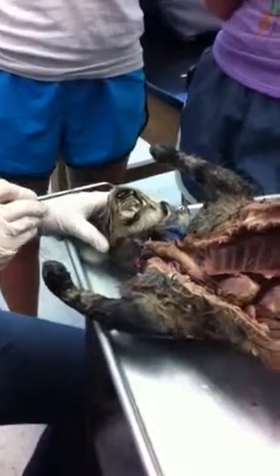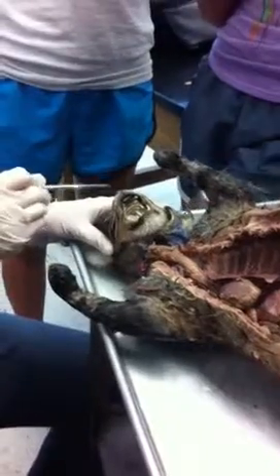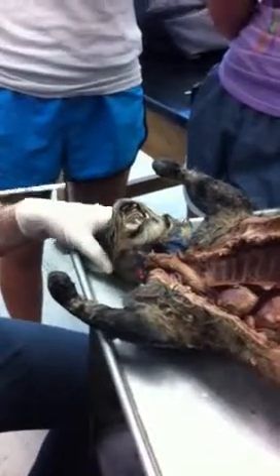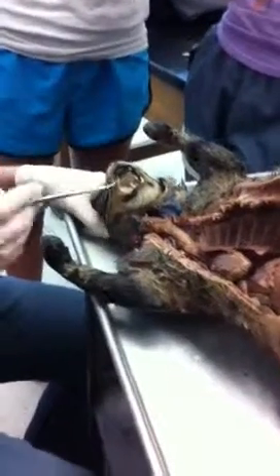Oral cavity, and here is what cavity? Nasal cavity. What are these called here? Nares. External nares. Very good. Which cavity is more efficient for breathing? Nasal cavity. Excellent. So we take in air through our mouth or our nose, and then where do we go?